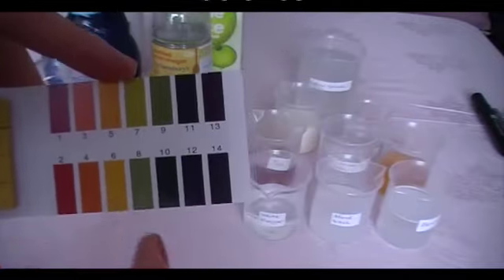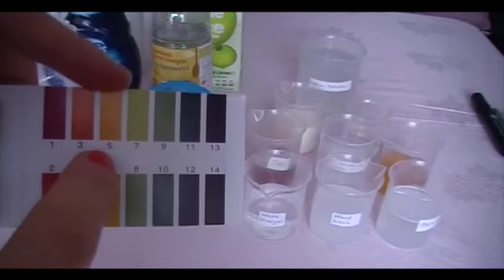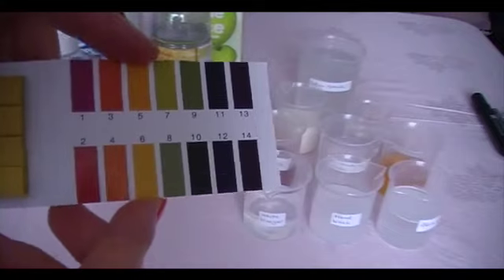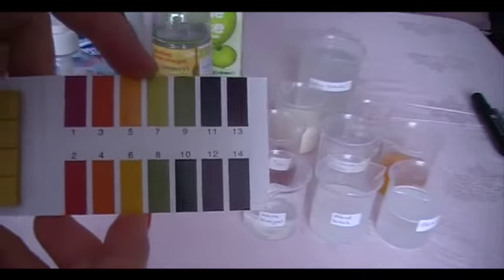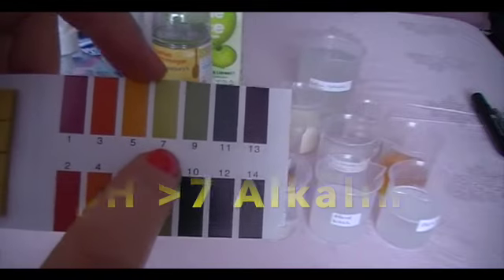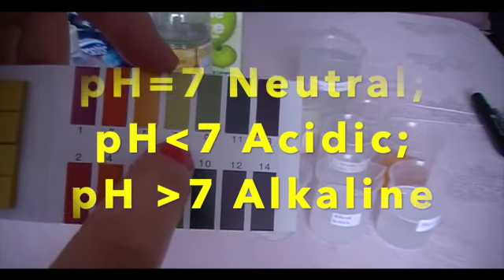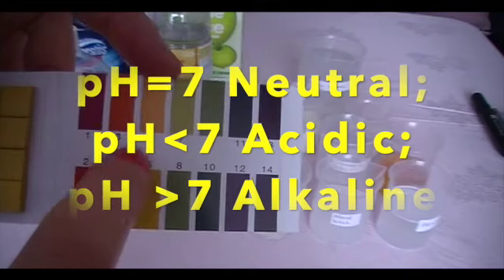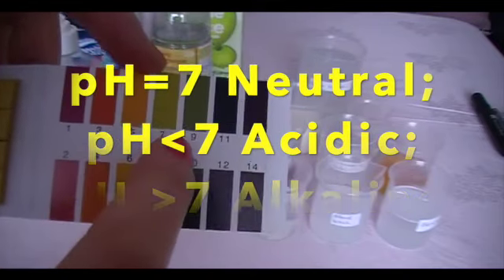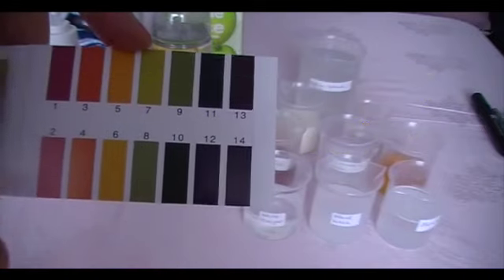If you match it up to the closest one, it gives you the pH number. Now we know for a neutral solution the pH would be 7. But if it's acidic, it will be less than 7. If it is alkaline, it will be greater than 7.